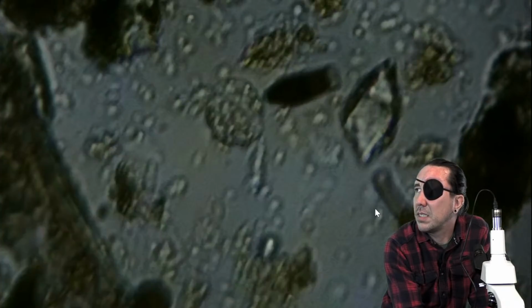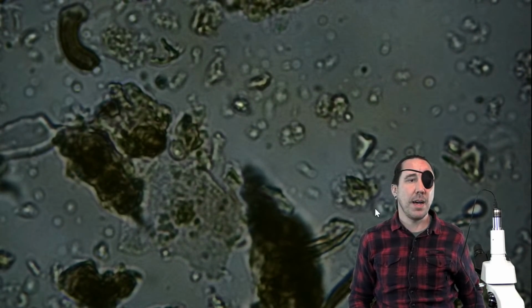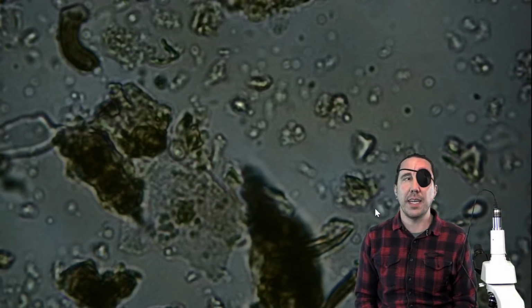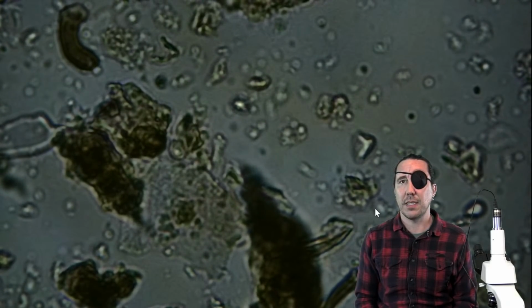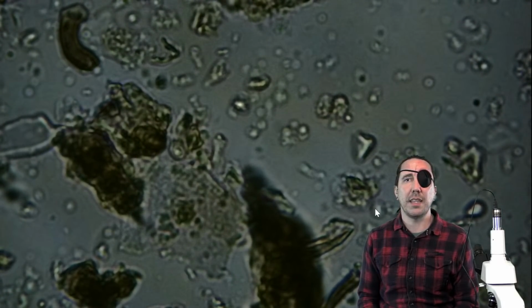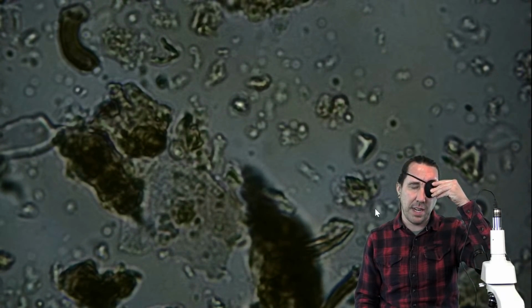Any more questions? Can you repeat the name of the microscope, the model, and the one that you're upgrading to? Yeah, the microscope that I'm currently using is an Omax, and I think omaxmicroscope.com is the website. The model number is M8311, and they also use that as the SKU, if you were to search on their website. And it's a little over $300.